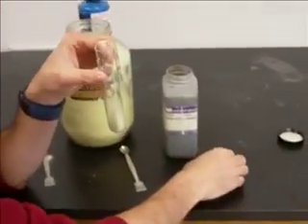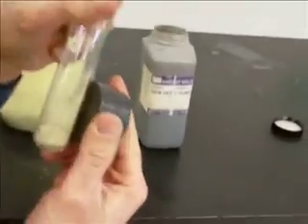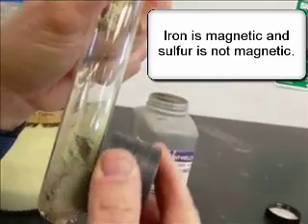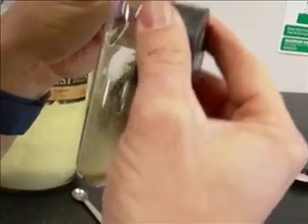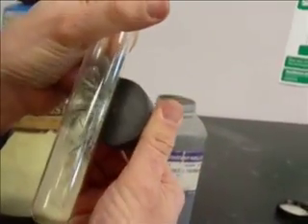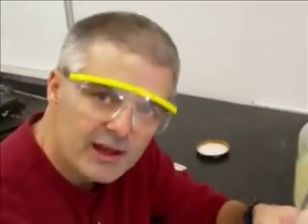Now, one way I can know that is I happen to have a magnet right here. And if I take the magnet, I don't know if you can see this. I think you can. I can move the iron. Iron, of course, is attracted to the magnet. So I can do that. The sulfur stays at the bottom. You can kind of see how the sulfur is not attracted to the magnet, but the iron is. So now this is essentially just a mixture of iron and sulfur. They have not reacted.